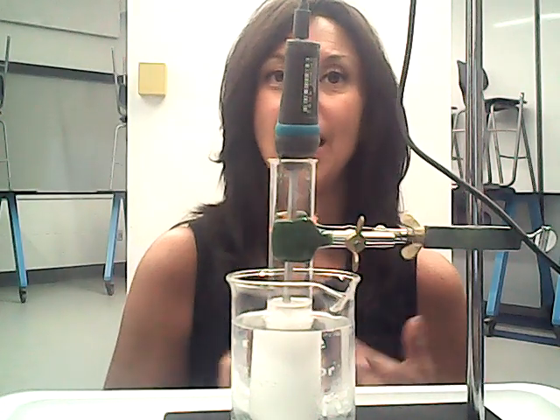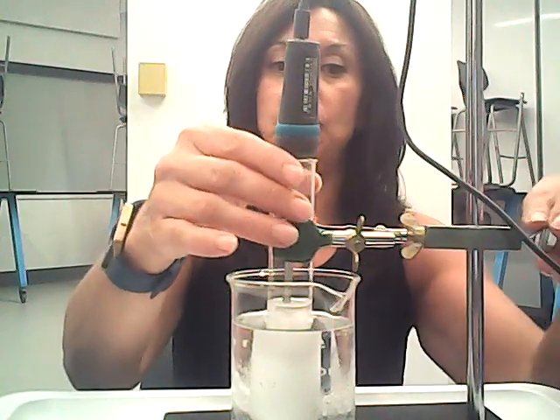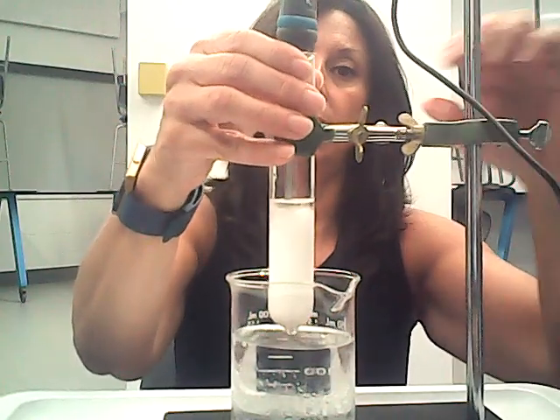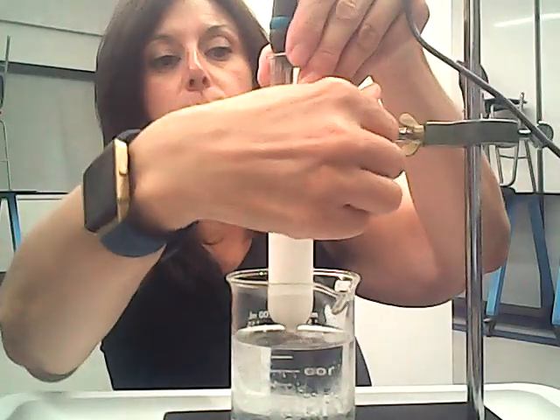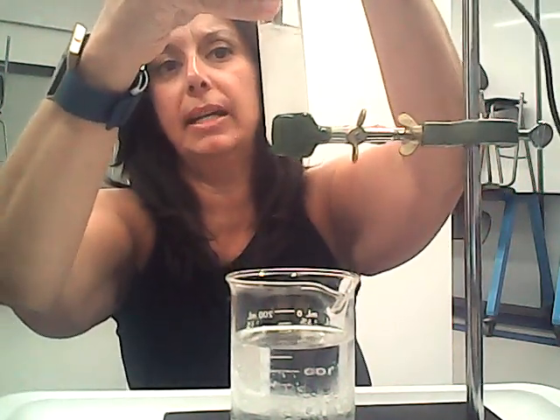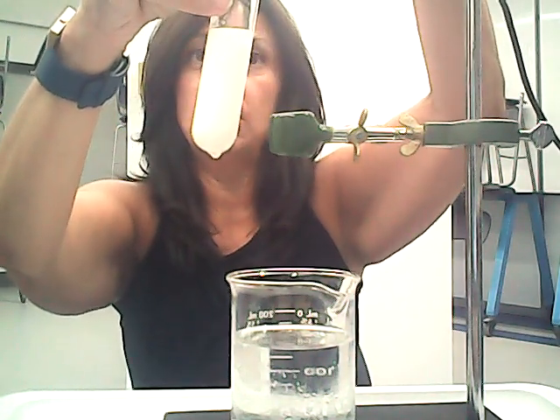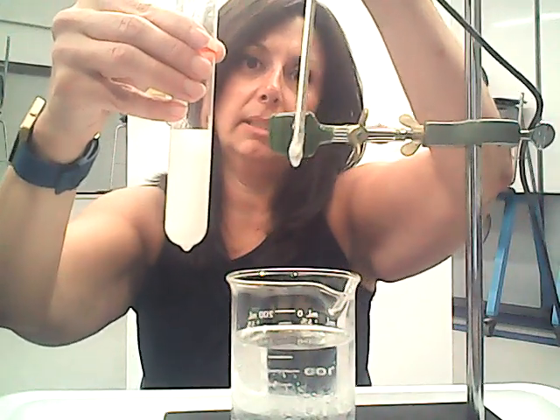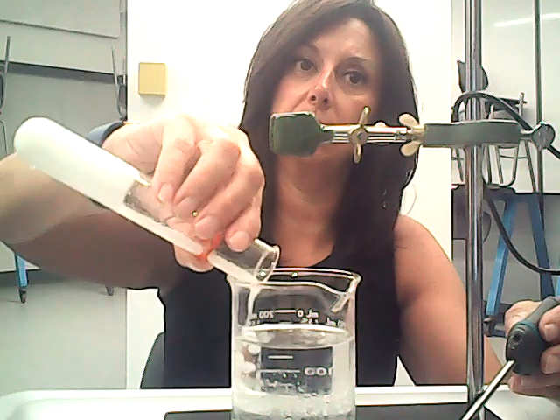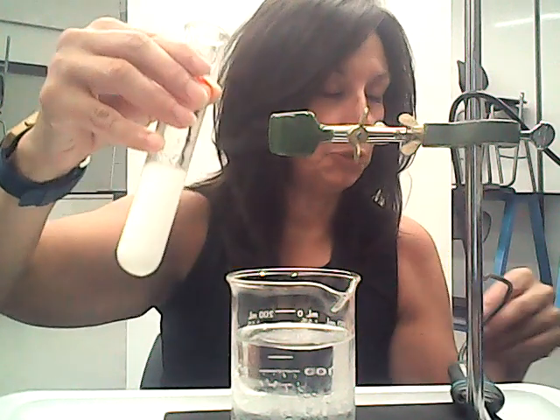Okay, you guys, so we have collected the data for 900 seconds. That's 15 minutes. Just to show you what it looks like now, as you can see, it has solidified. It's a little bit liquidy at the top, but for the most part, I can get my temperature probe out there. The final temperature, you can see it's got the solid, but I'm going to show you by dumping it. You can see it's sludgy, but it's pretty solid there. It's not dumping. And the end temperature is 20.7.